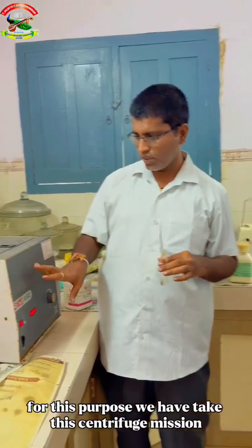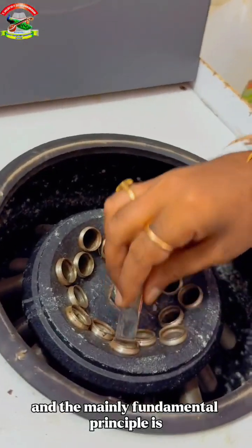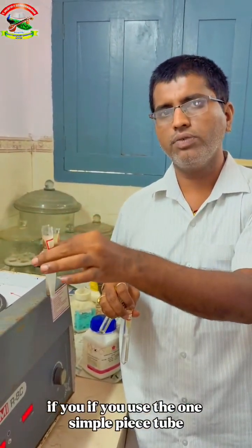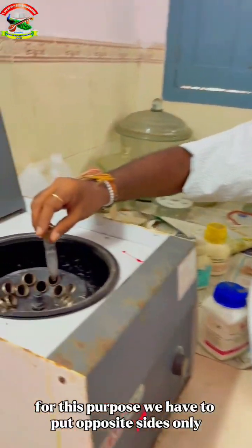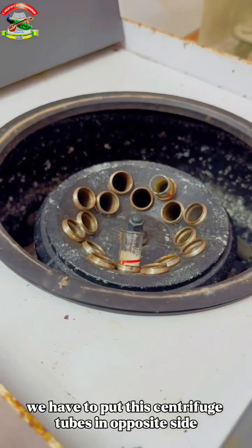For this purpose, we have taken this centrifuge machine, and the centrifuge machine consists of this type of arrangement. The fundamental principle is that we have to put two tubes compulsorily. If you use only one centrifuge tube, the instrument will get damaged. So we have to put them on opposite sides only, not side by side. For operating this instrument, we put these centrifuge tubes on opposite sides.